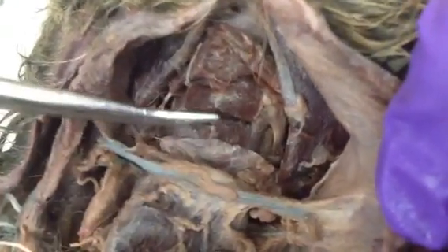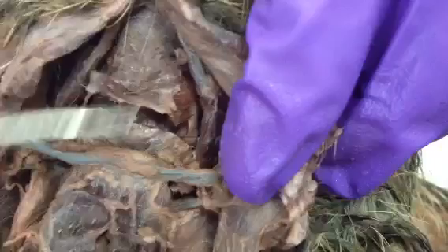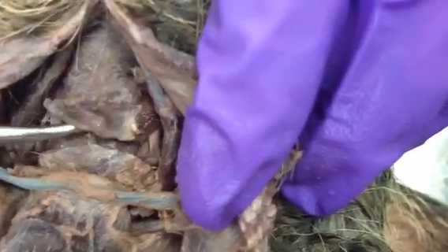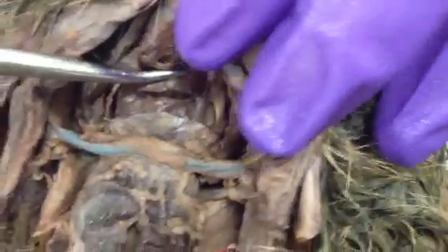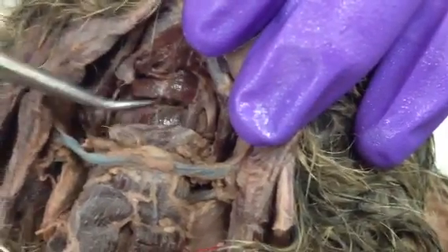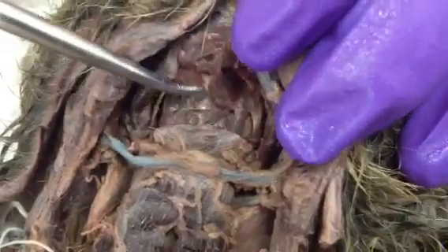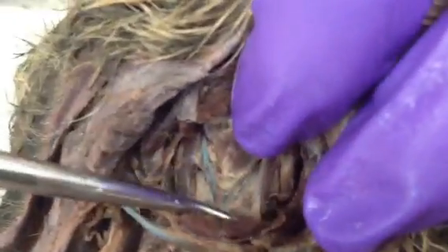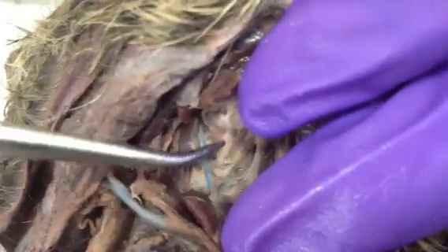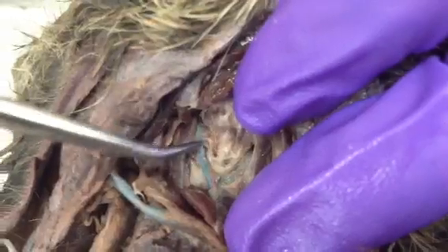And then whenever you cut through the mylohyoid, like I have here, mine's just kind of pushed away. The mylohyoid is here. When you look underneath it, here, you'll see the geniohyoid, and there's two of them. Mine just aren't split in half. And then underneath the geniohyoid, you have the genioglossus, which is this little muscle right here. It's hard to see mine clearly because it's so small.